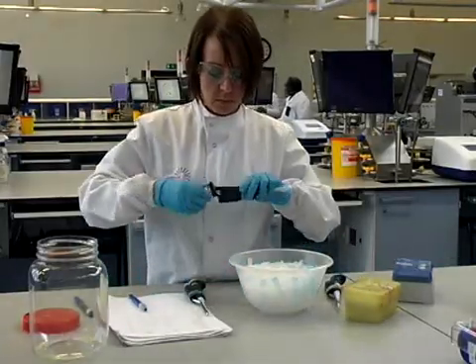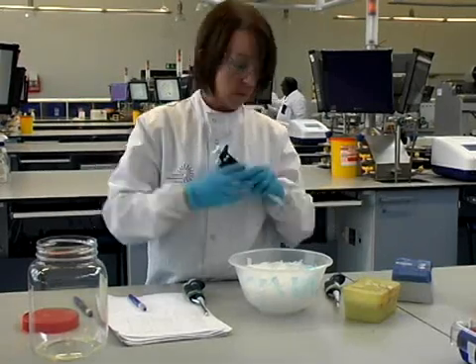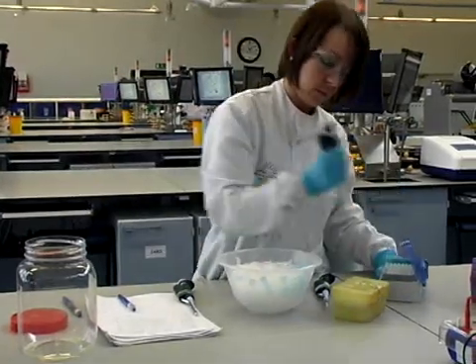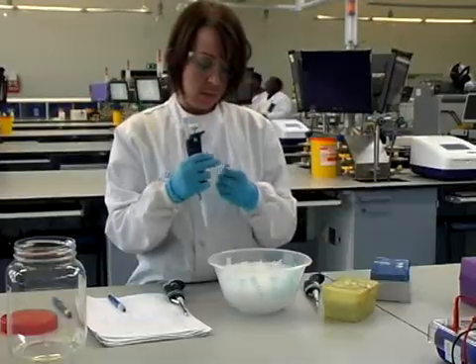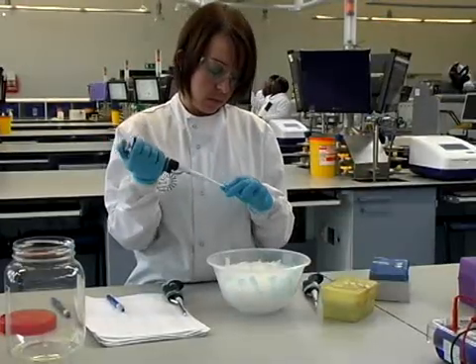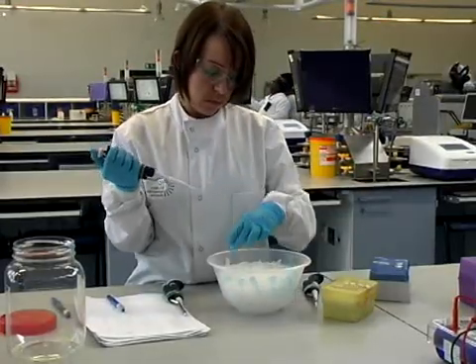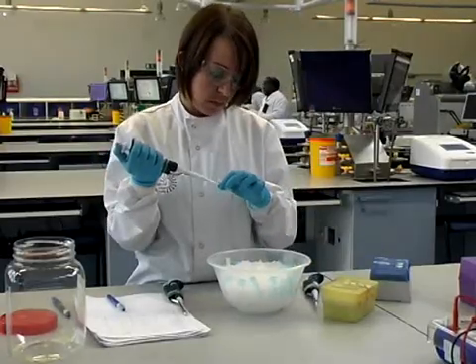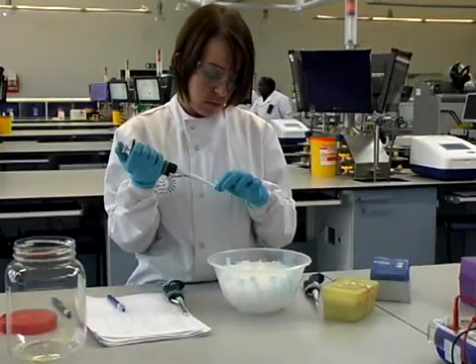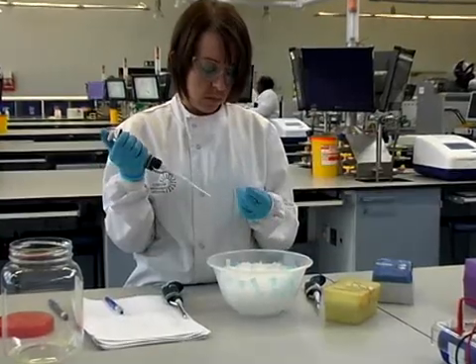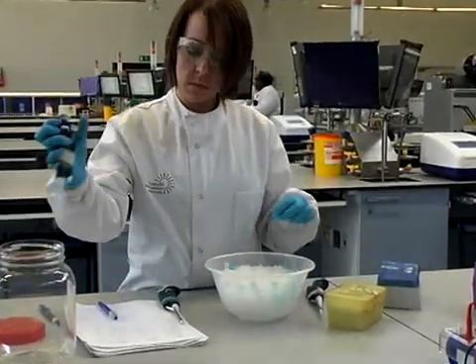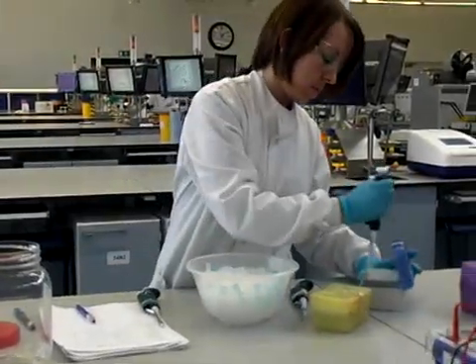So now we have our four tubes ready with the master mix present and all that remains is to add our DNA sample to each tube. The tubes have been pre-labeled beforehand and the scientist just checked the tube to make sure she was adding the correct sample to the correct tube which is vital when you're doing any assay.